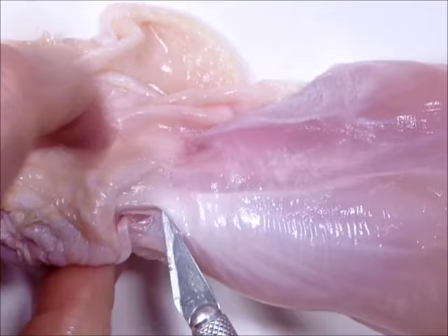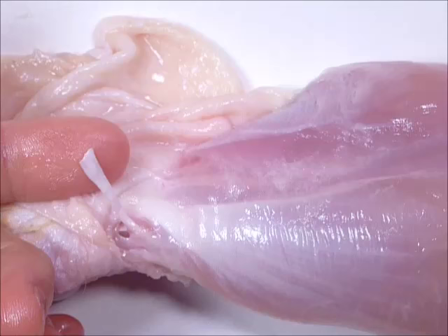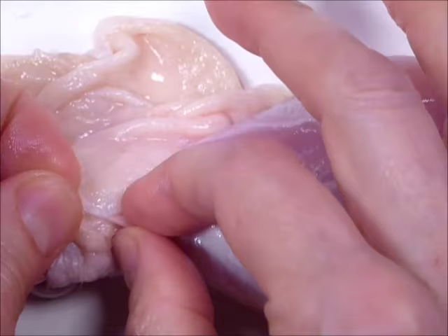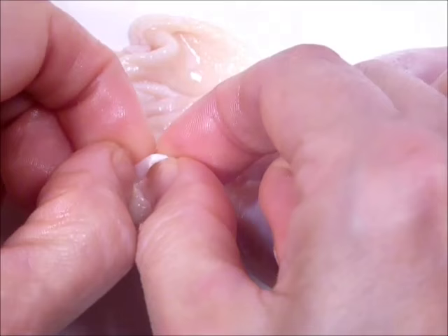Here is the tendon — I've just pulled out a tendon right there. Check mark: we found regular dense connective tissue. This is regular dense, so all the collagen would be going the same way. It's very, very strong. If I pull on it, it's extremely strong — just about impossible to tear. It'll tear away down here before this will tear.